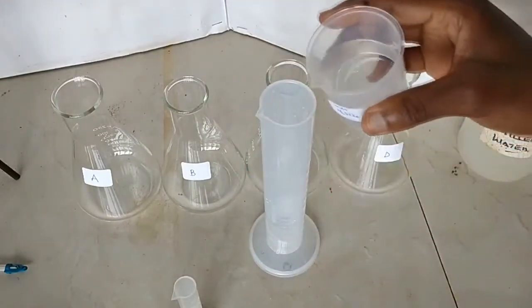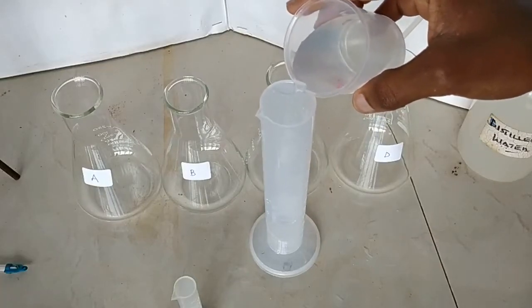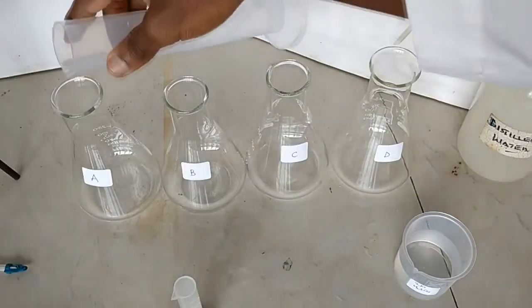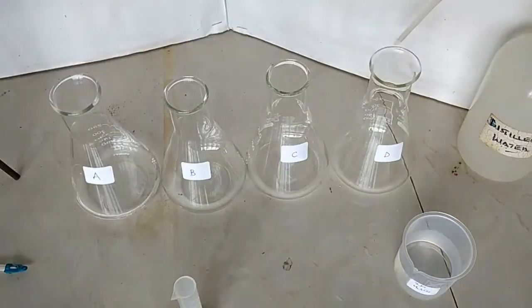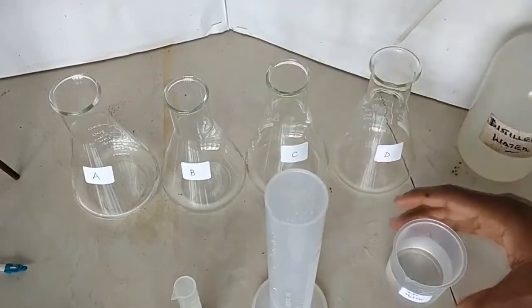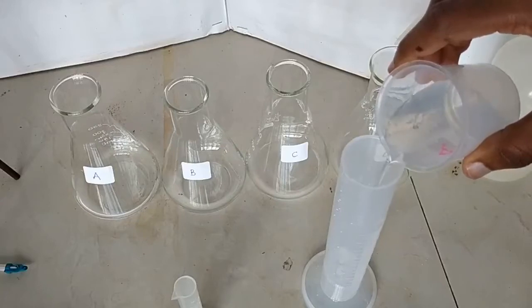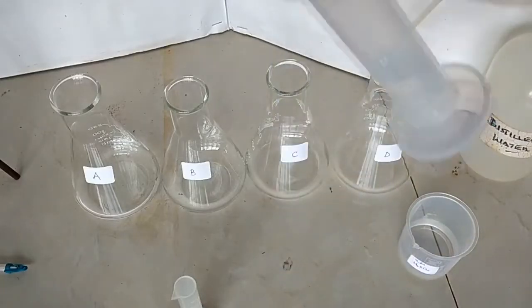Make sure that you have your eye at the 40 mark level to avoid the parallax error. This is exactly 40 — put it in flask A. Then measure 30 centimeters cubed of the 2 molar sulfuric acid and place it in flask B. That's 30 centimeters cubed in flask B.